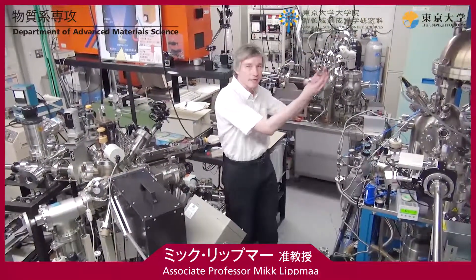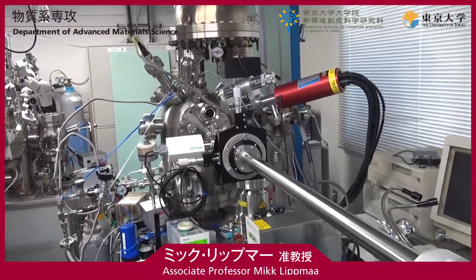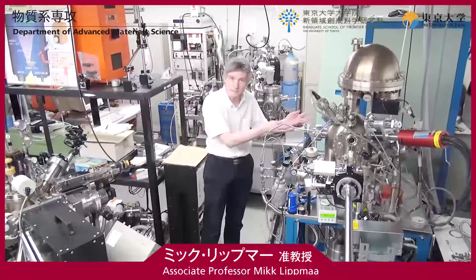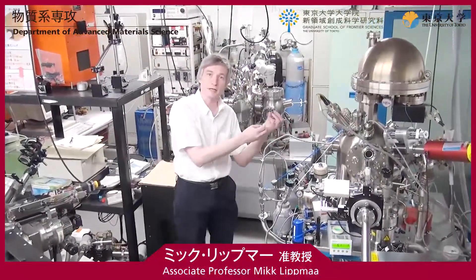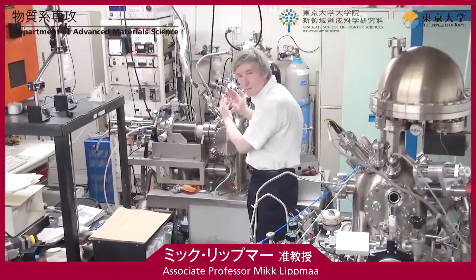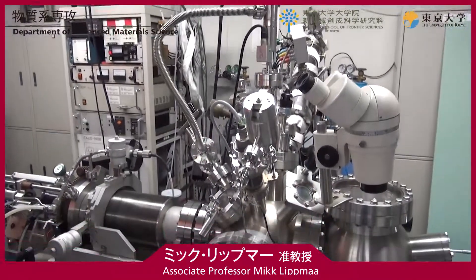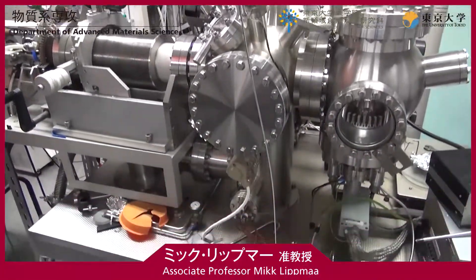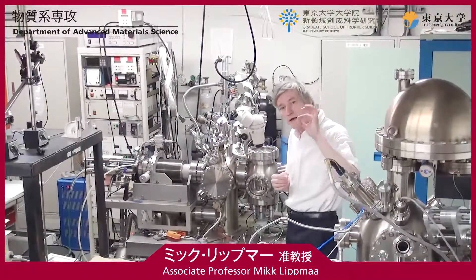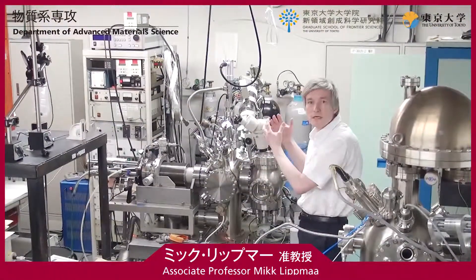For example, we can take the materials to the system here for analyzing chemical compositions. This system is known as X-ray photoelectron spectrometer, or XPS. Another choice is to look at the surfaces of these materials, and for that purpose we go to the machine which you can see over here, which combines a tunneling microscope and an ion scattering spectrometer. By combining all these machines, we can make these very, very small nanoscale structures and characterize their properties.